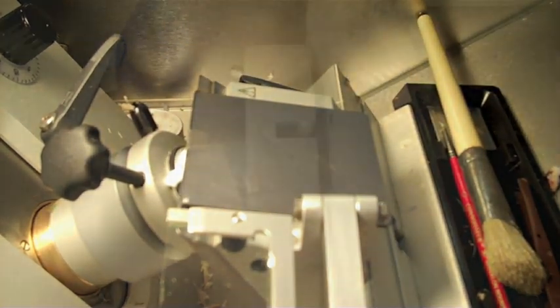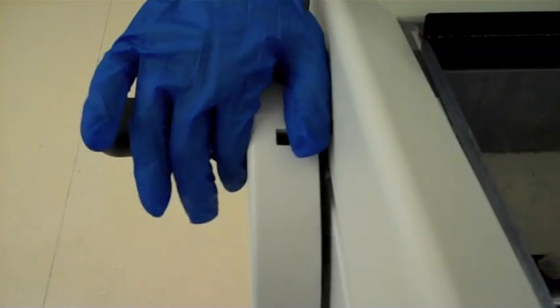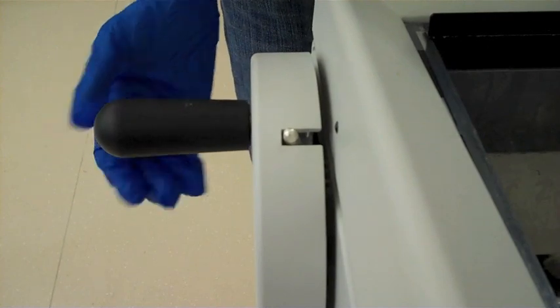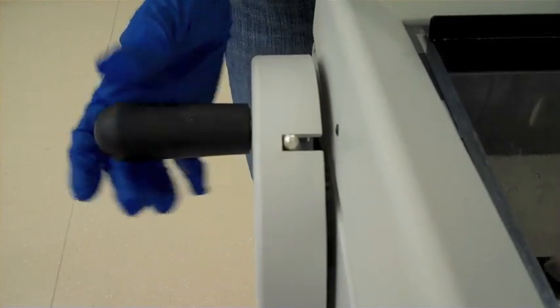Use the locking mechanism to keep the specimen holder in place when you are manipulating the blade and or the mounted tissue.